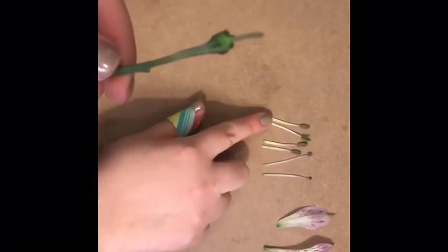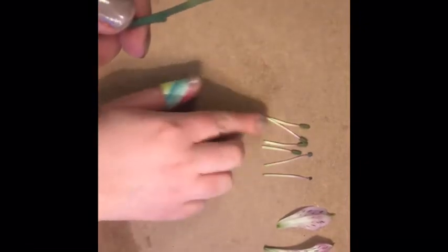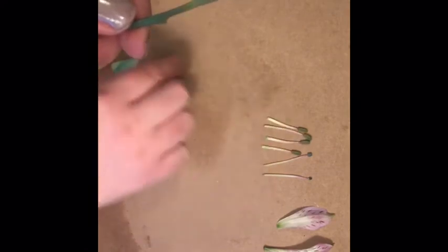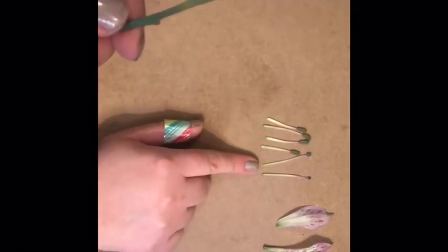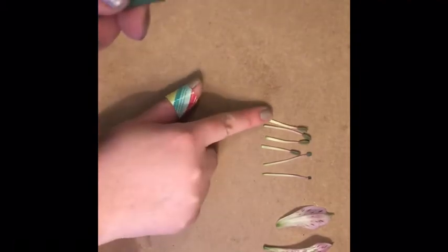So as you can see, I've taken the liberty of removing all of the stamens and the petals. There are 6 in these flowers specifically. We have the 2 that do not have the covering on, and these little bits at the top are where the pollen is, and then these ones. And then what is left is the female part.